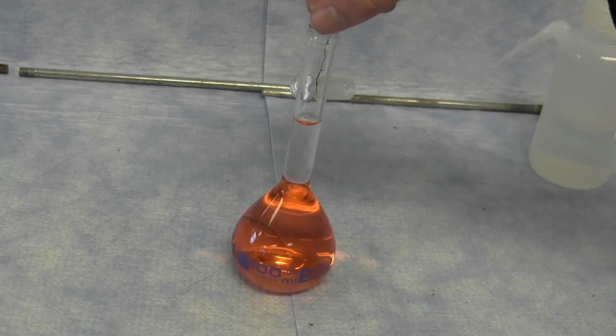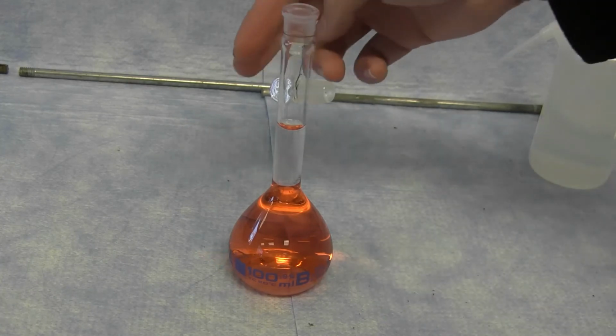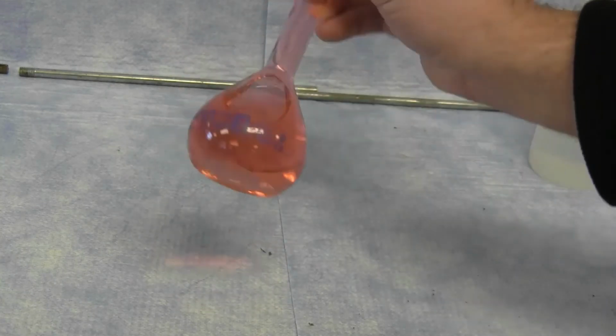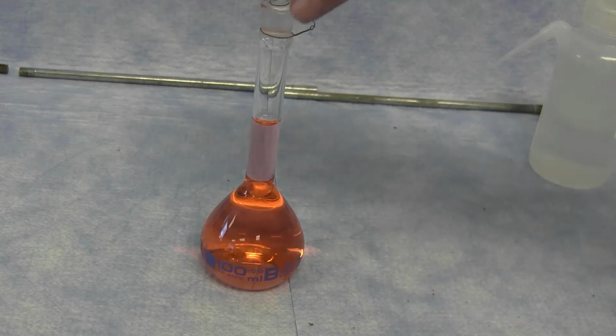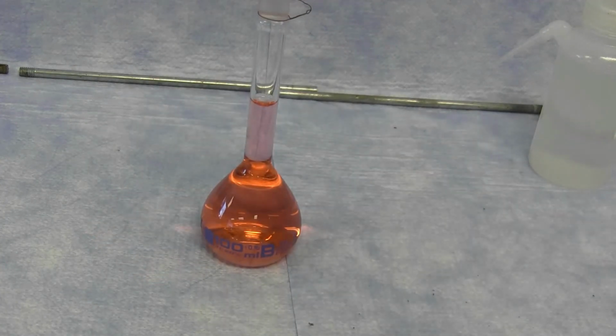Once the water is exactly at the mark on the volumetric flask, it contains a total volume of 100.00 milliliters. You can then stopper the flask and invert it to make sure that the solution is thoroughly mixed. At which point you can save some of your solution and then make other solutions using more of the stock solution. In total, you will be making 5 different solutions in volumetric flasks at varying concentrations of the stock solution.